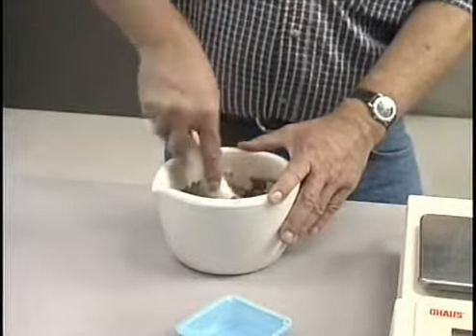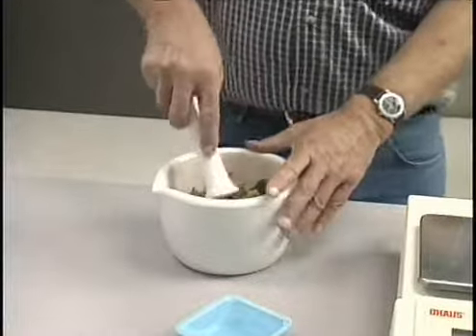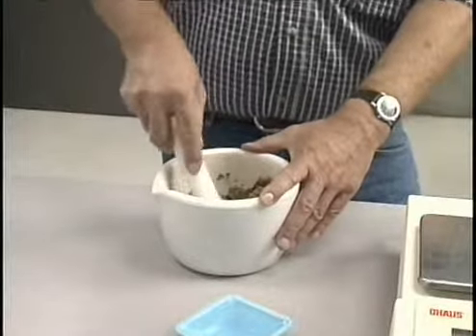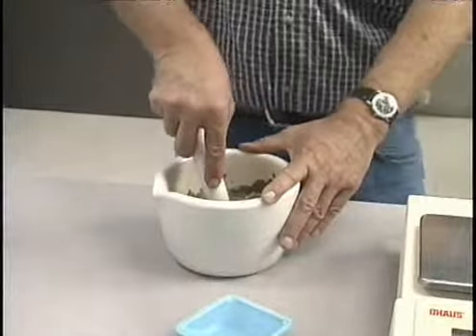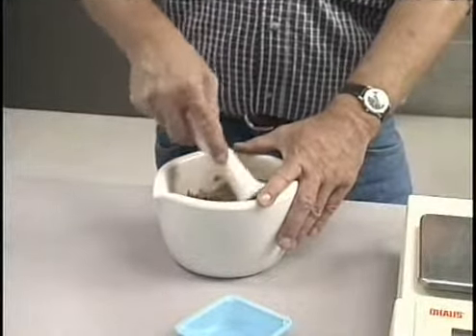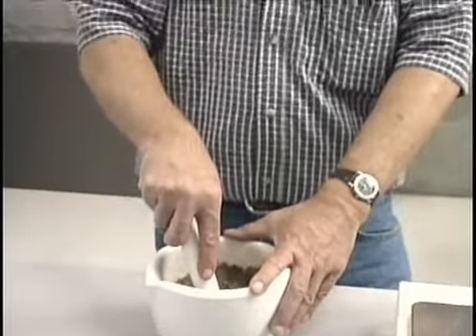Now, in this handout, you have a formula that is used to determine the settling rate or the velocity at which these various soil particles will settle. Basically, we're not going to be working with that formula per se, but with information that's derived from that formula. That formula tells us that sand-sized particles will settle out of a soil suspension in 40 seconds. It tells us that silt-sized particles will settle out of a soil in approximately 2 to 2.5 hours. And for the purpose of this lab, we will be using the 2-hour time interval from the time that we've last suspended them until we believe that the silt-sized particles have settled out.